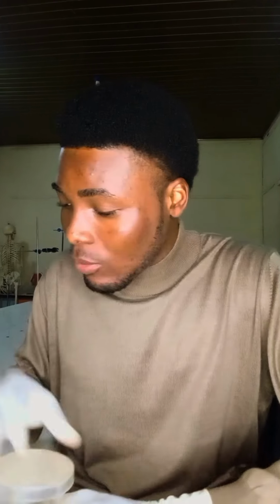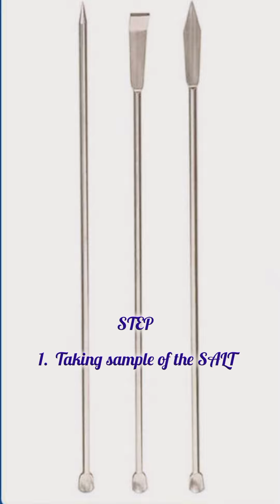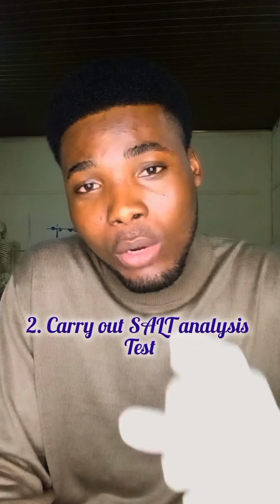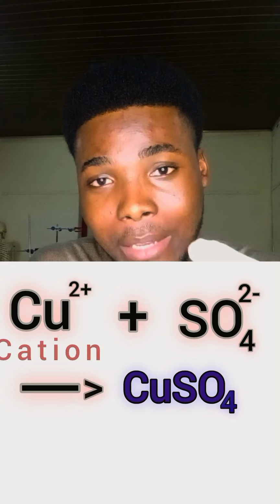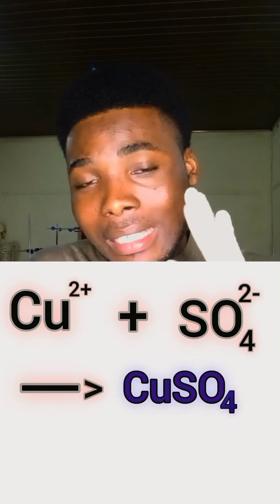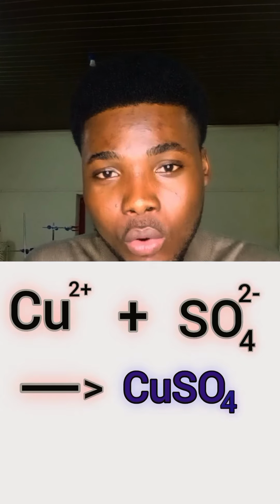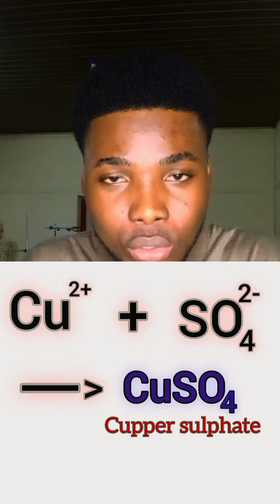Basically, I can take a sample of this salt using a spatula, and then I will carry out a salt analysis test on it. When we say copper sulfate, there are two sides to it: the cation and the anion. The cationic part is the copper ion, and the anionic part is the sulfate ion. These two together are copper sulfate. We call it copper(II) sulfate, or you just say copper sulfate.